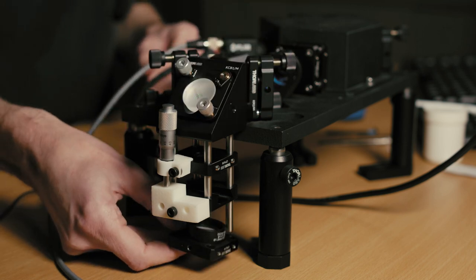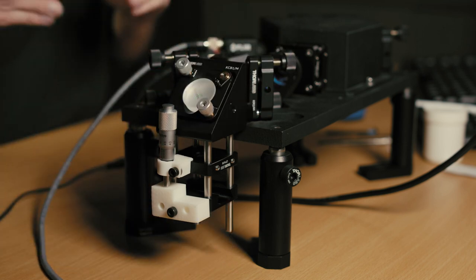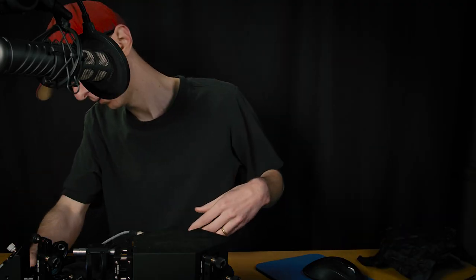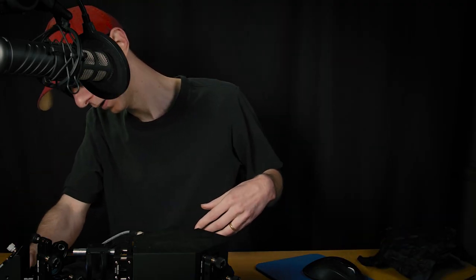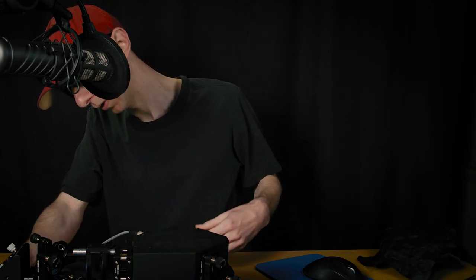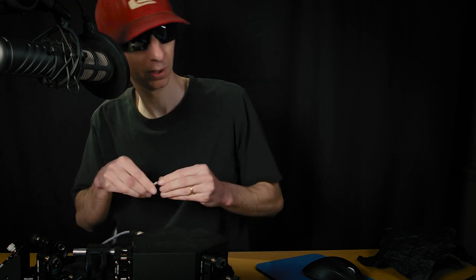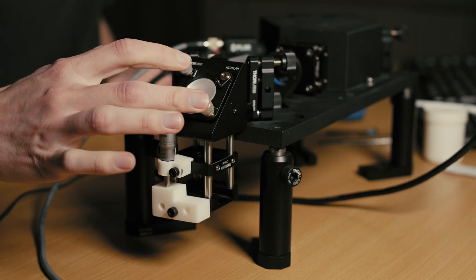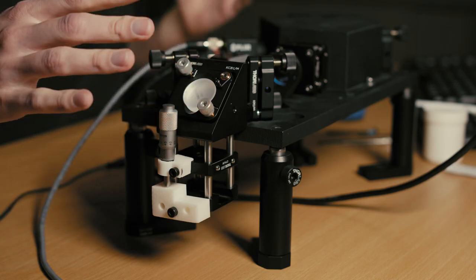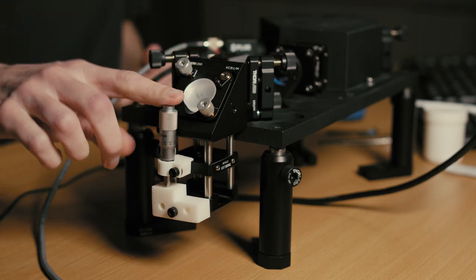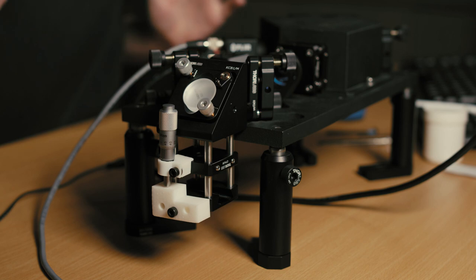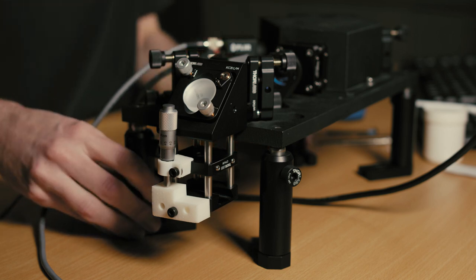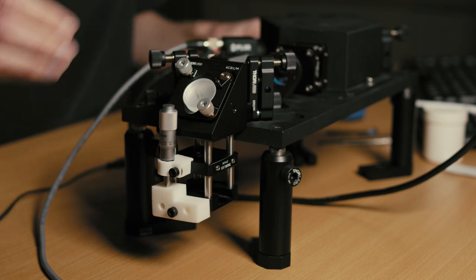I will now remove this tooling. We are done with the tooling. We know that these tools are centered and this one is at the nominal position 6.25 millimeters. That's from the design.